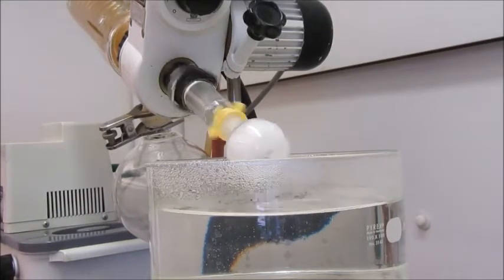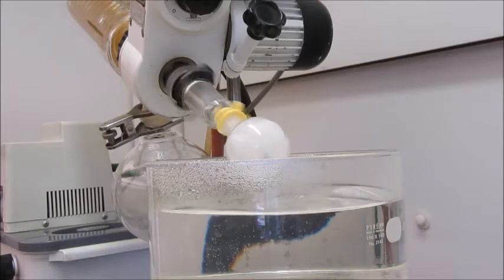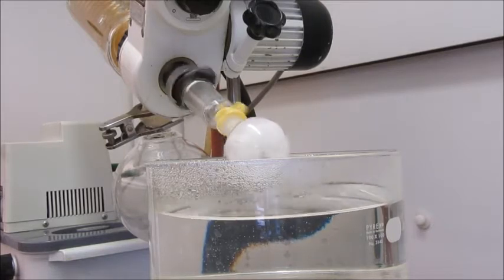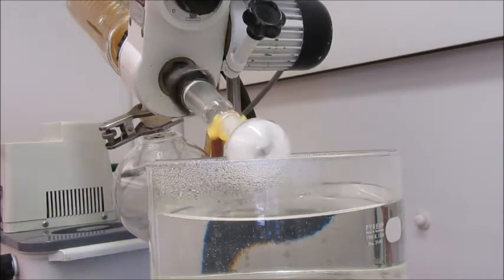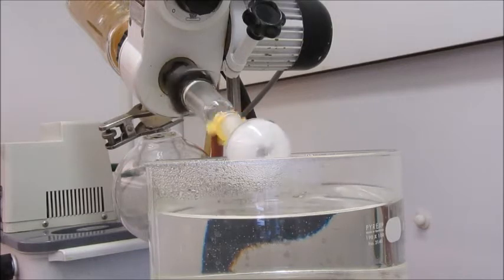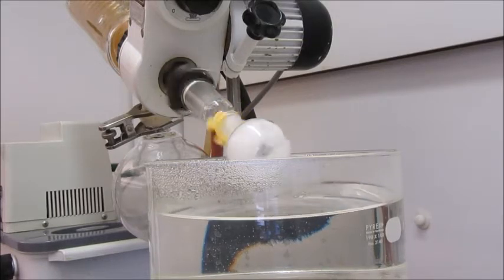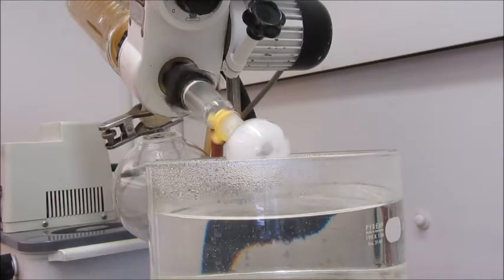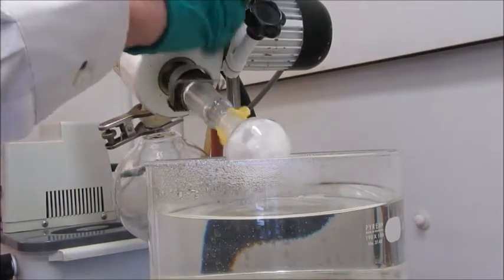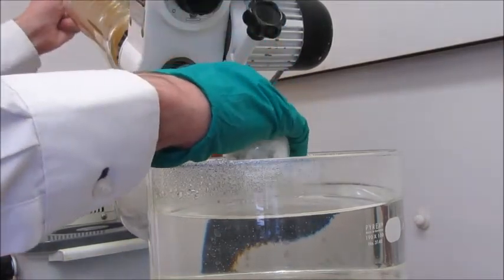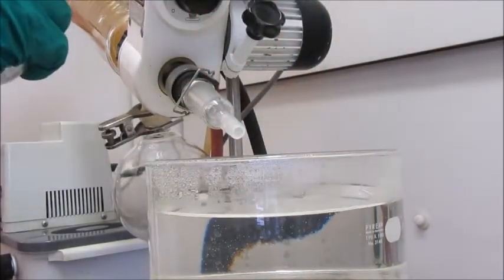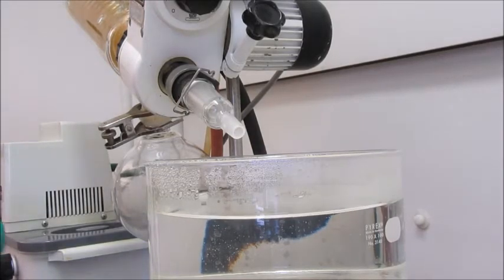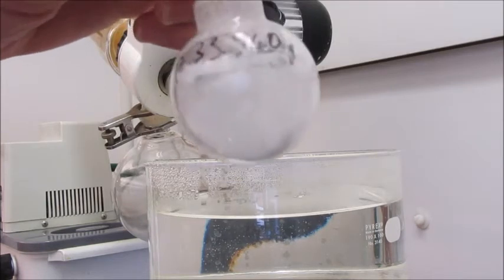Okay, so now I've removed the water bath. I can turn this off and break the vacuum. You need to break the vacuum on the equipment but leave the pump running. You do not want to switch off the pump before you break the vacuum, or you could suck water back into the rotovap. And there is our final sample.